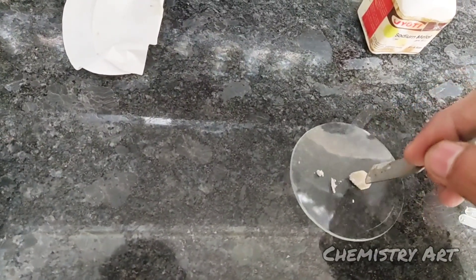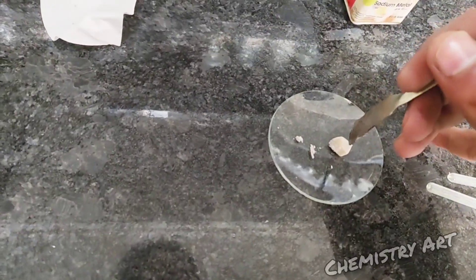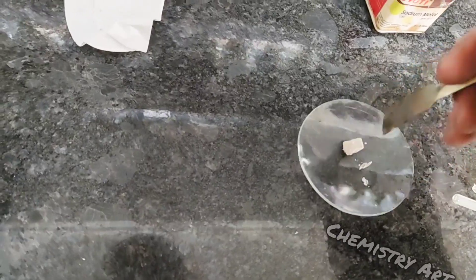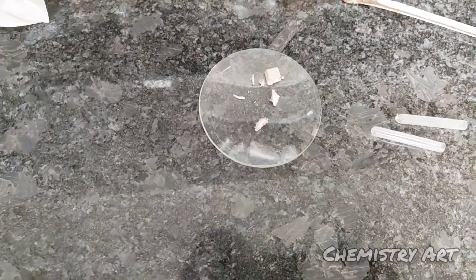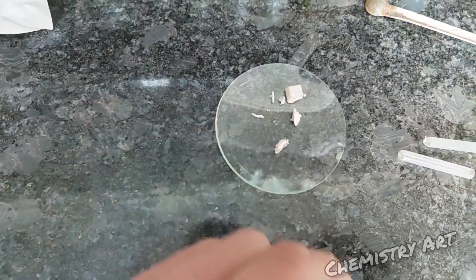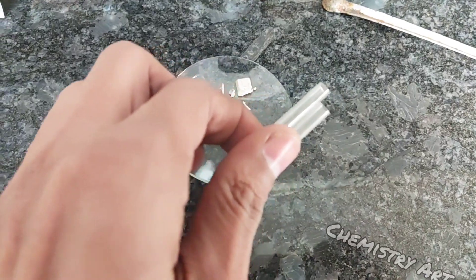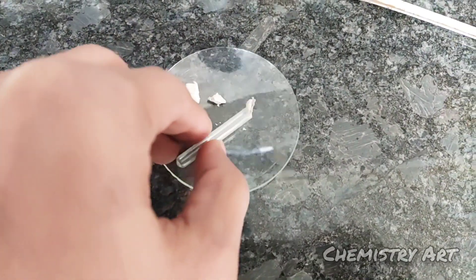You can take one piece the size of rice and place it in a fusion tube. Take two fusion tubes and add this small piece of sodium into both fusion tubes one by one.